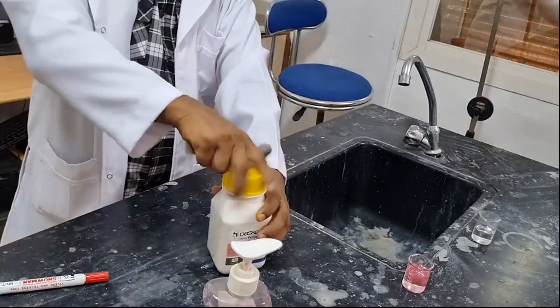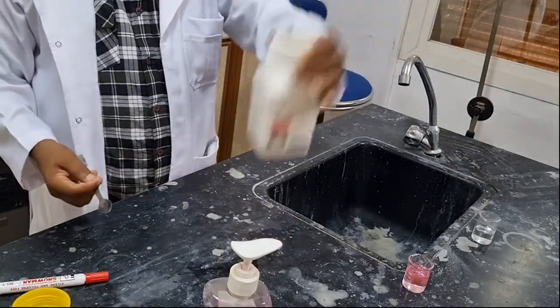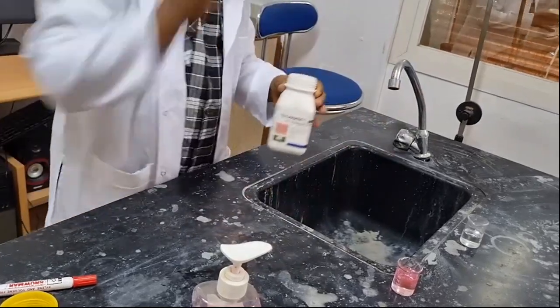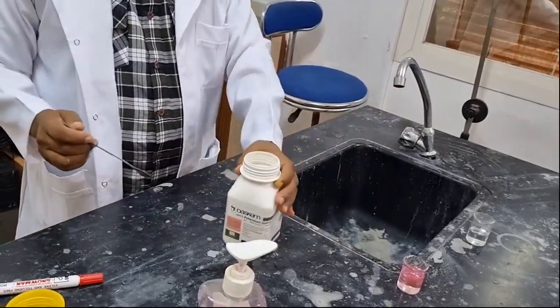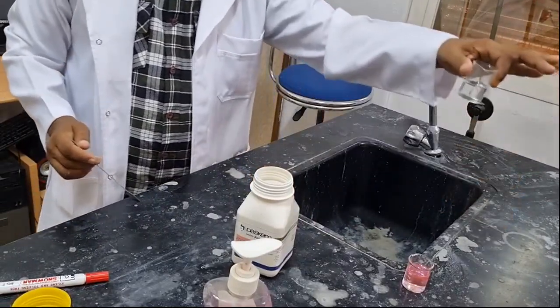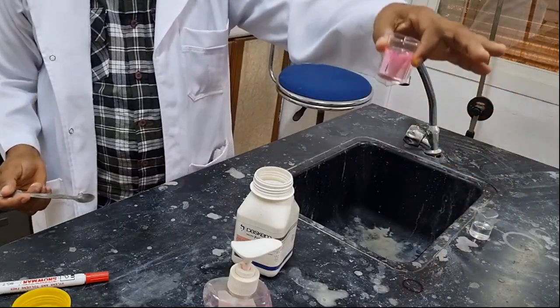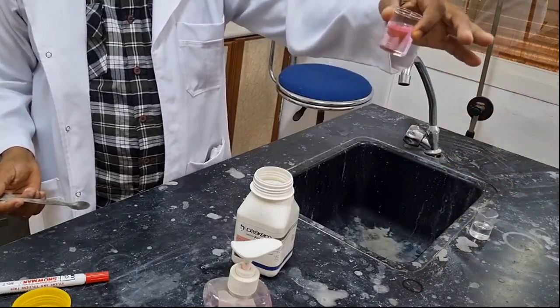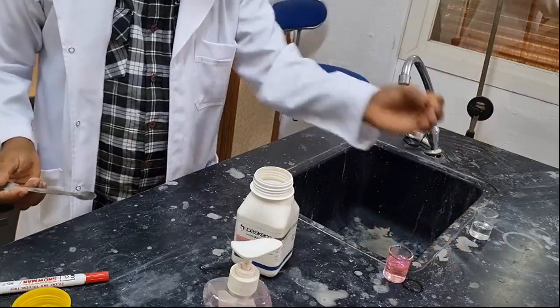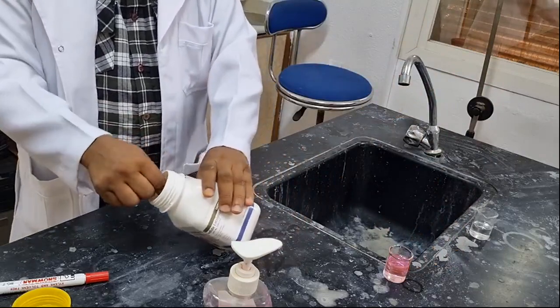But when potassium iodide, the catalyst, is added to facilitate the decomposition process, the decomposition in this free hydrogen peroxide will be so fast. But when it contains some liquid soap or detergent, the reaction will be somewhat slower, but shows some amazing scene. You will see it.